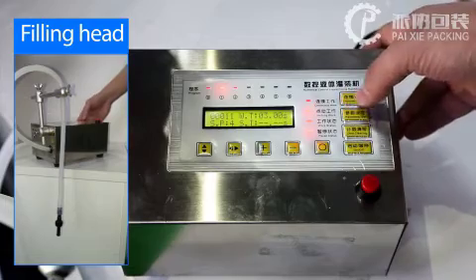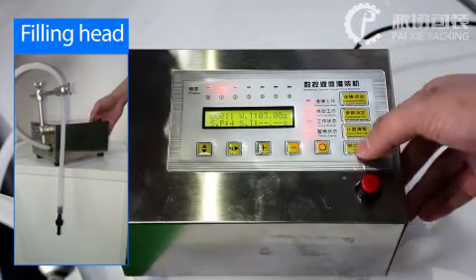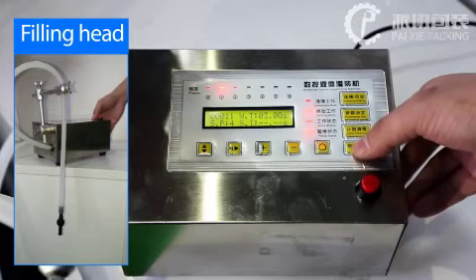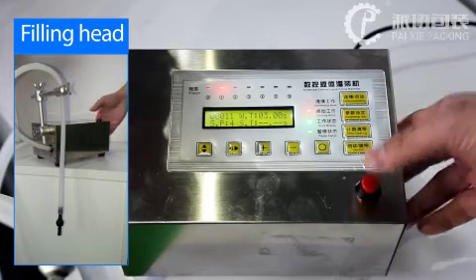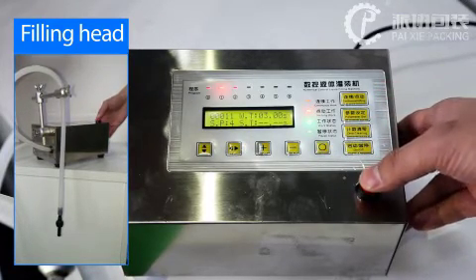So now it's manual working. Let's test the manual working and press the power button and press the red button.